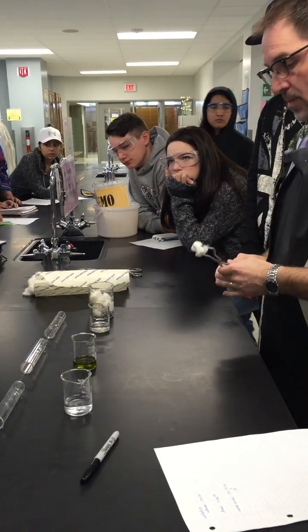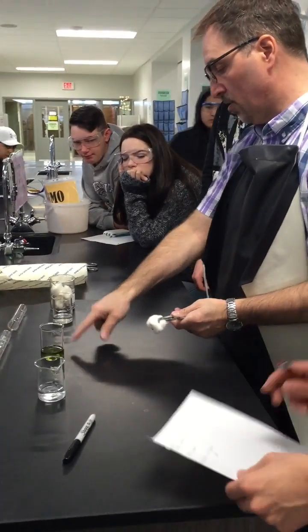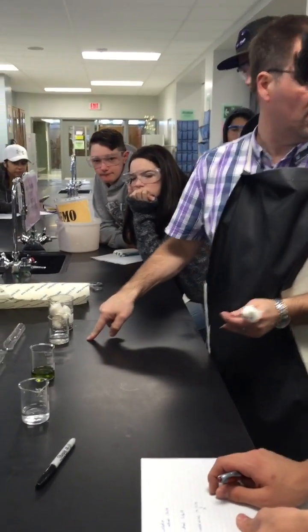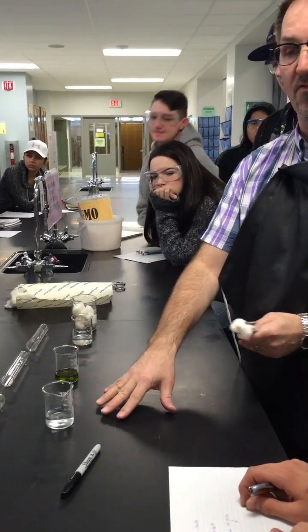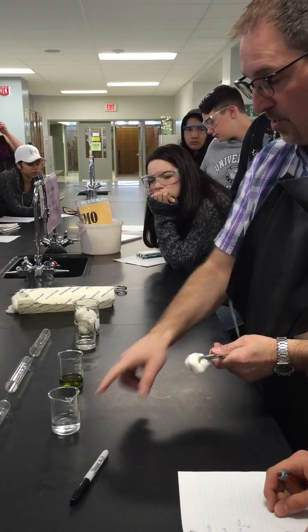Soak a cotton swab and first of all we have the methanol, then we've got the ethanol, and then we've got the isopropyl alcohol. You've got the formulas for all these. This is the most complex, this is the least complex.